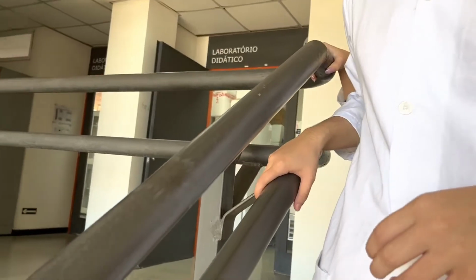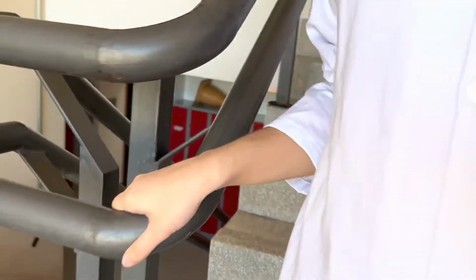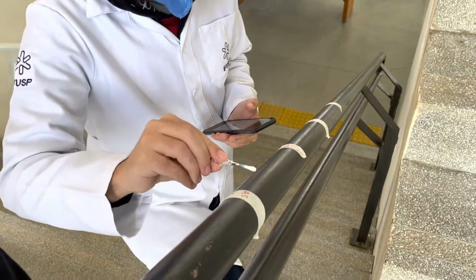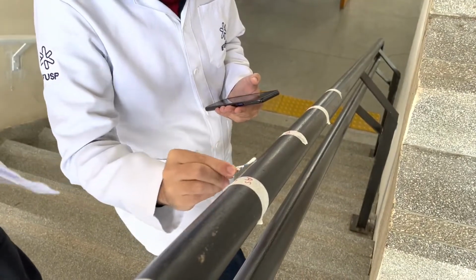The surface chosen for the experiment was the handrail of the first floor of the Alpha 1 building in the São Bernardo do Campo campus of UFABC. The samples collected before the cleansing were collected with autoclaved swabs, swabbing it 3 times on different sides of the swab.